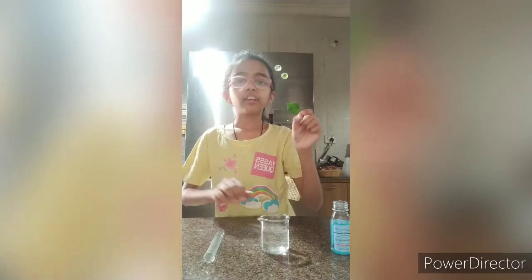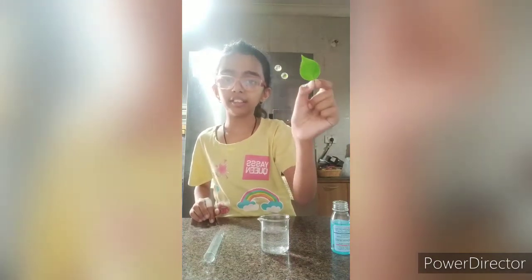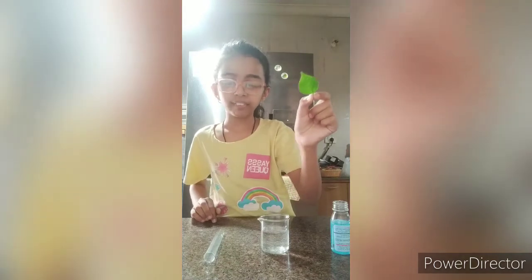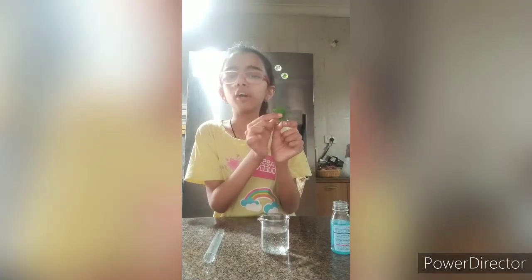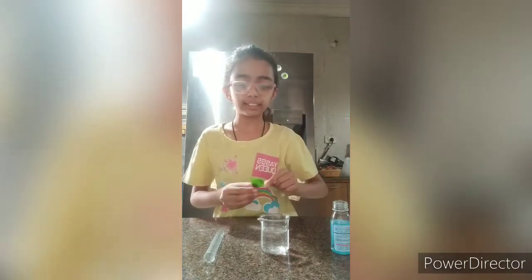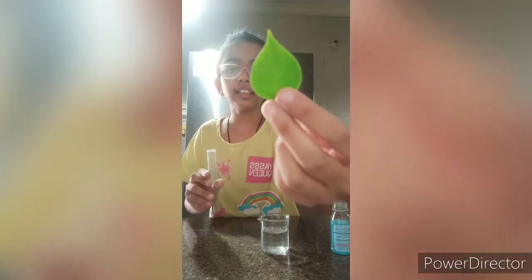Now, how do I find out that starch is present in this very leaf? First, I will take out the chlorophyll, which is the green colour of the leaf, from the green plant. I will take the leaf and place it in a clean clear test tube.